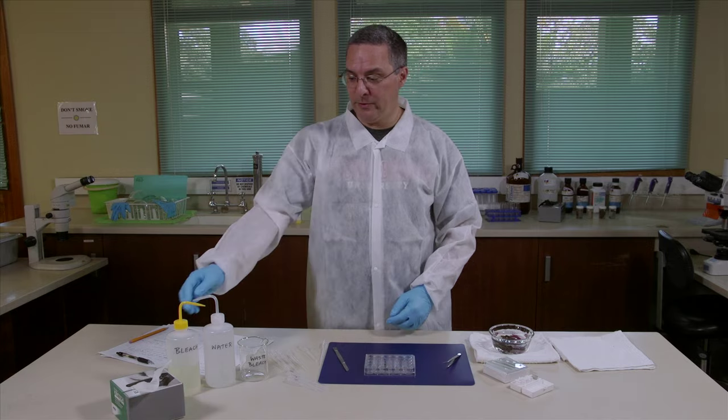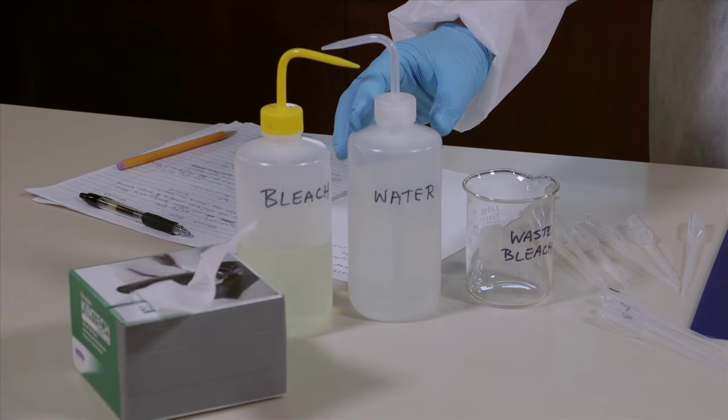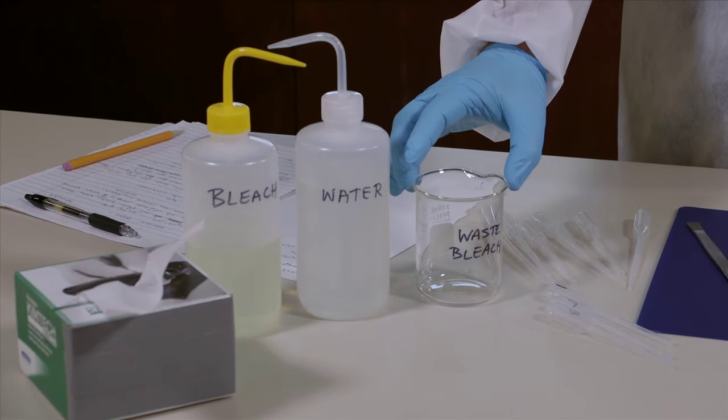To get started make sure you have a lab coat, gloves, and some kind of eye protection or eyeglasses. We're going to use household bleach, water, and you'll need a container to hold the waste bleach.